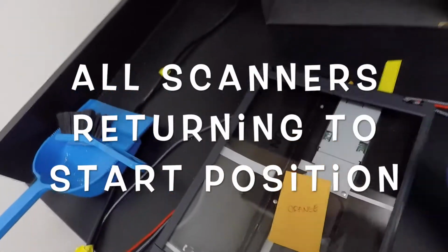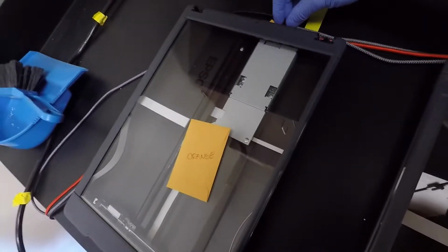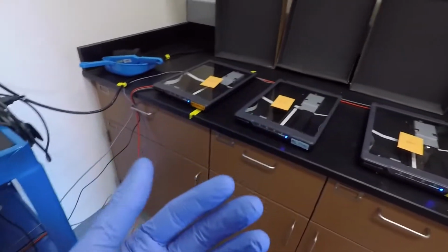Now, the reason we run them in this order is because we had an issue with this scanner where this cable in the back was loose. You can see that's why we tried to tape it to secure it in place, and it wasn't working correctly, and we were losing a lot of samples because of that.